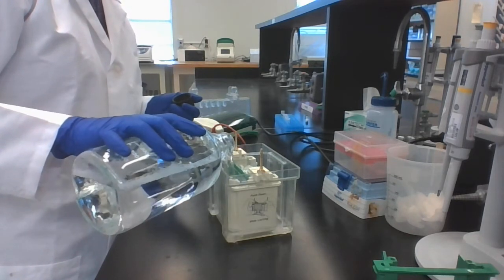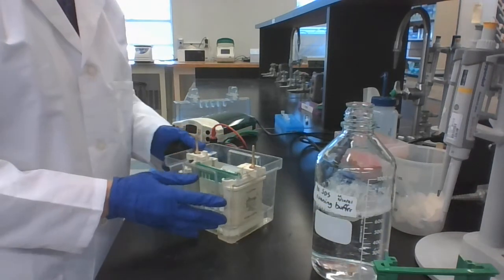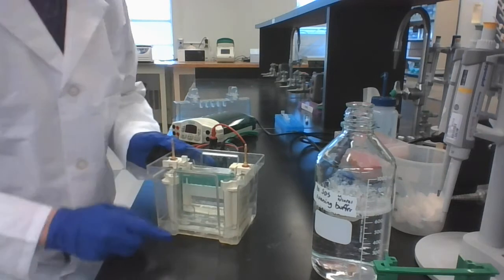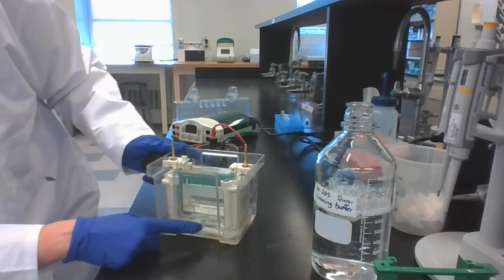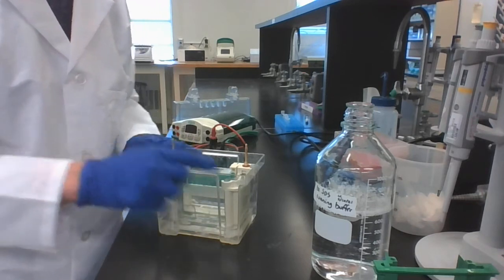And then you want to pour some down into the outer part, to the outside of the tank. So now in the middle, you have it full of buffer. And on the bottom, you want the level to be above where the buffer dam or the glass plates are.